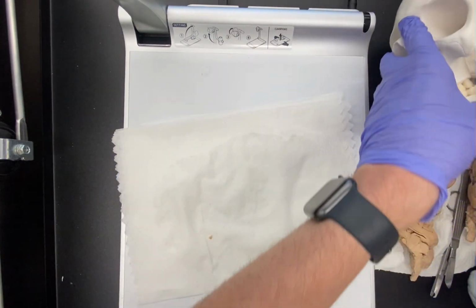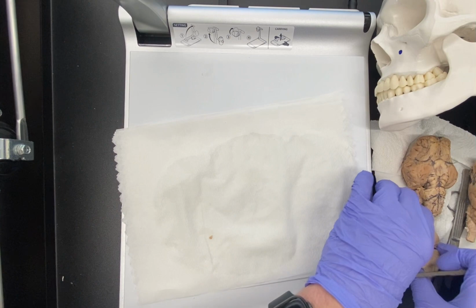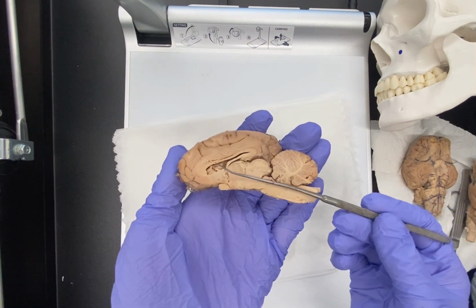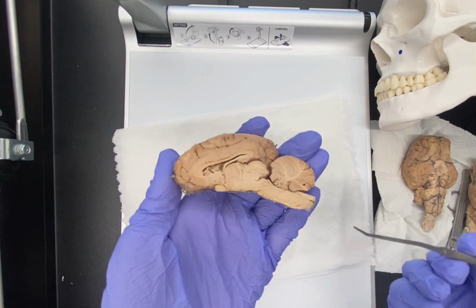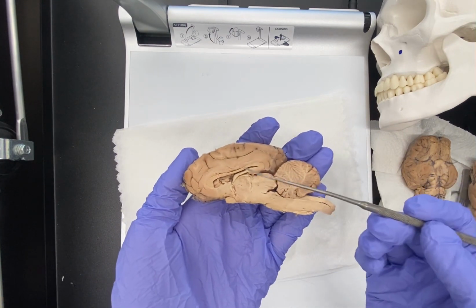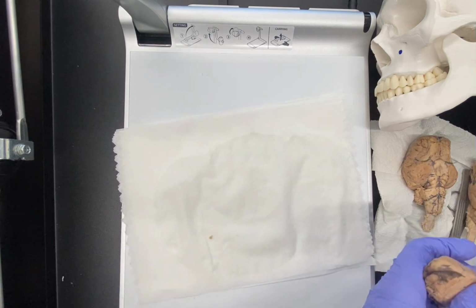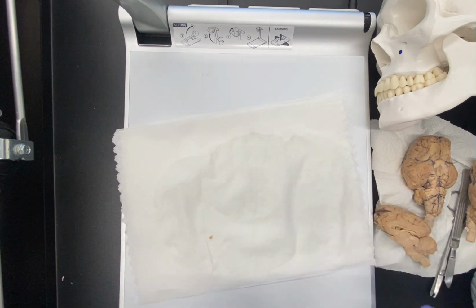Okay, I'm going to set this off to the side. I'm going to bring back in the sheep brain. So again, remember, here's our sheep brain: brainstem, spinal cord, more horizontally oriented. So if we look at the skull of an animal that is a quadruped, walking on four legs as opposed to two, you would expect to see an equivalent thing. You would expect to see the foramen magnum more at the posterior side of the skull, as opposed to the underside, the ventral surface.